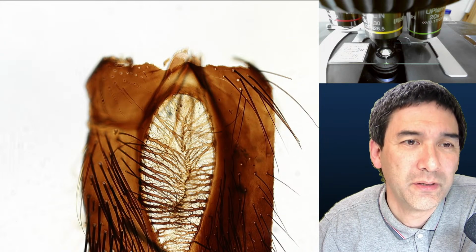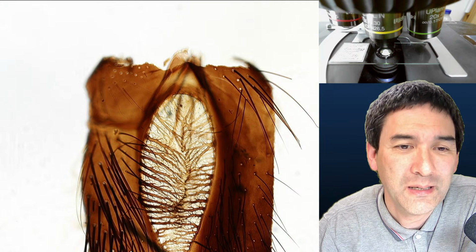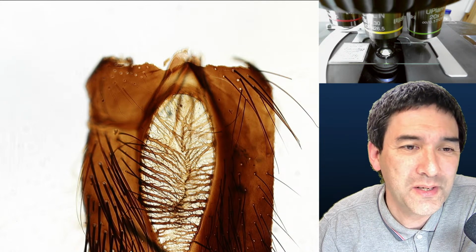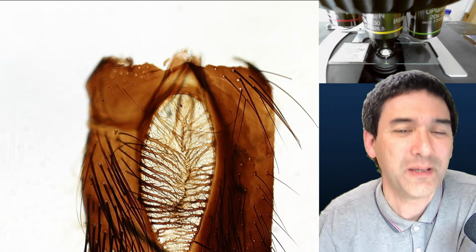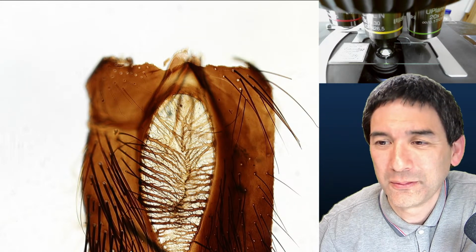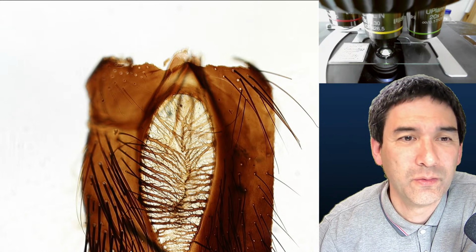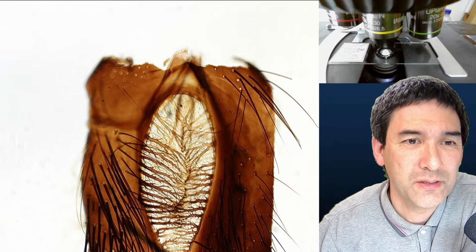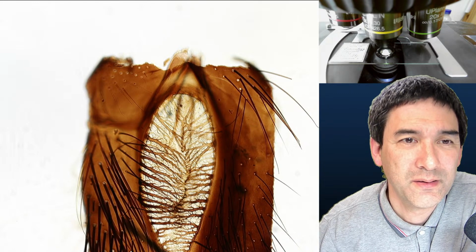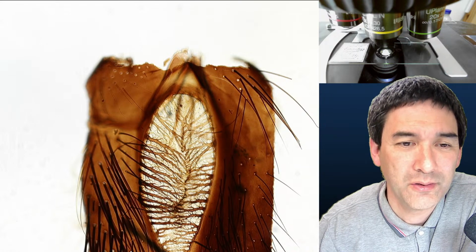So the shutter speed, it's a little bit more clear up here. Do you see that? It's more crisp here. So maybe I was slower here at the beginning, but then down here I was maybe a little too fast, and that's why it's kind of blurry. So this is something that you have to be careful about. Over here it becomes a bit more crisp. So maybe I was a little too fast down here.